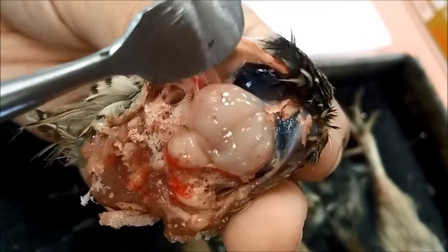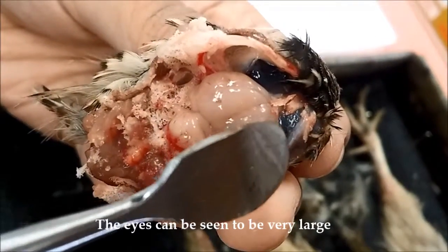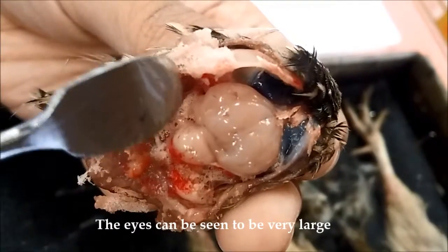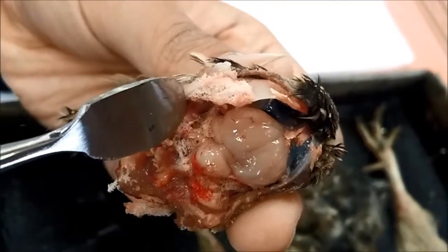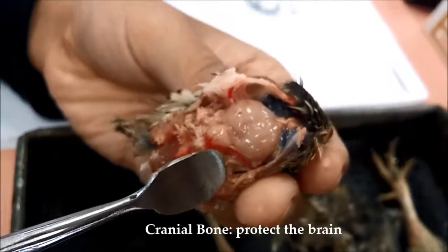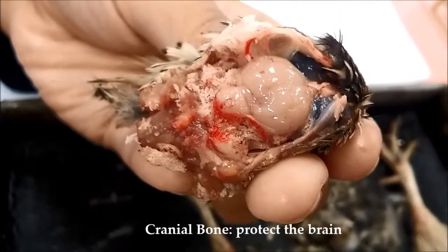And also we can see this is the eye of the bird. The optic lobe is not clearly seen here because it's at the back. And this is the cranial bone. Alright.